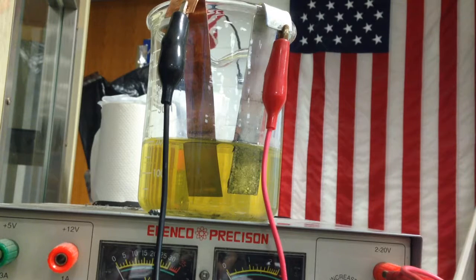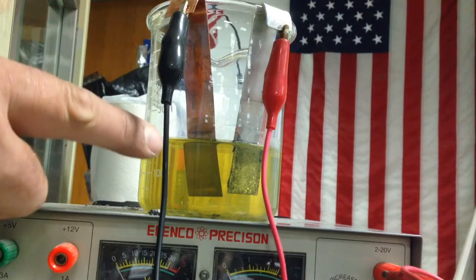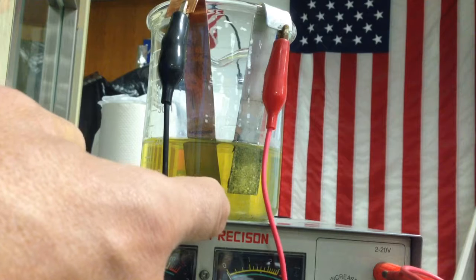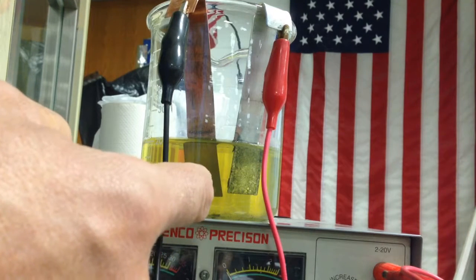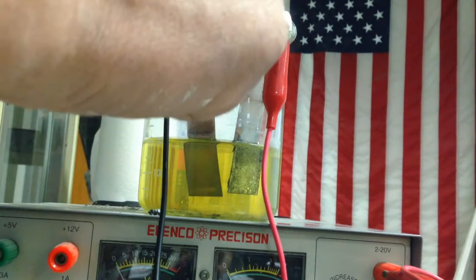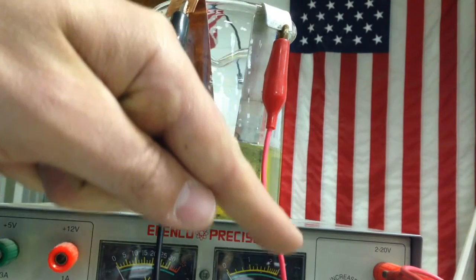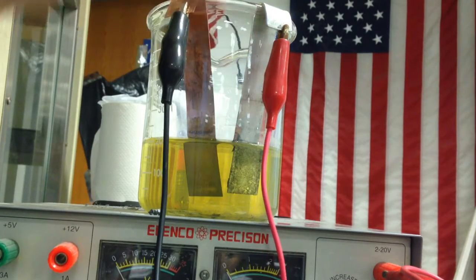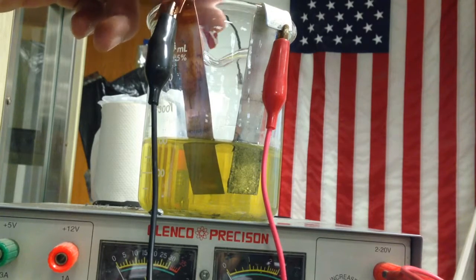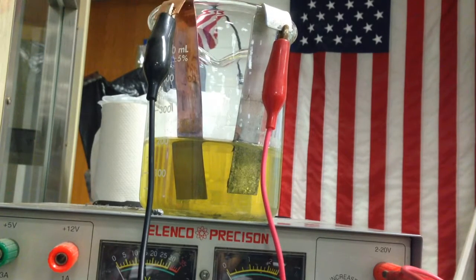I'm going to turn this on, and we should have a flow of charge from the anode to the cathode. At this point, tin plus 2 in solution should be getting reduced onto the copper, which didn't occur naturally. And over here at the anode of the electrolytic cell, we're forcing charge back to the battery, and tin 0 becomes tin plus 2, so we're replacing the tin ions. So let's just stop talking about it. Let me turn this on. I just don't want these metals touching because charge will flow along the path of least resistance.